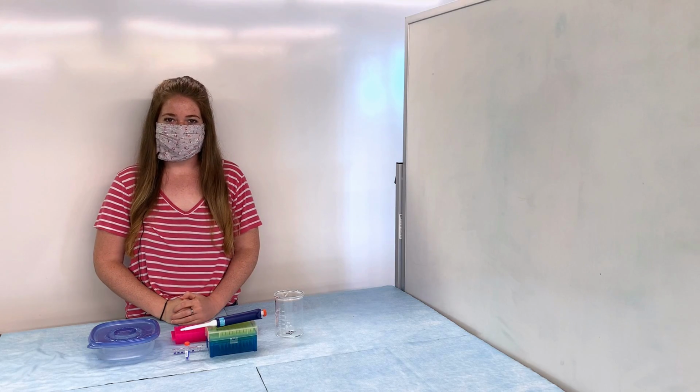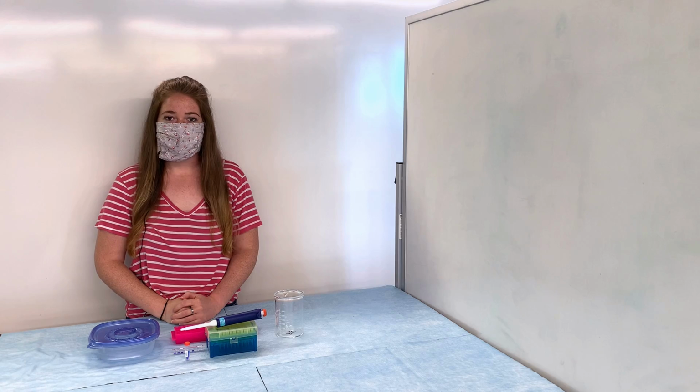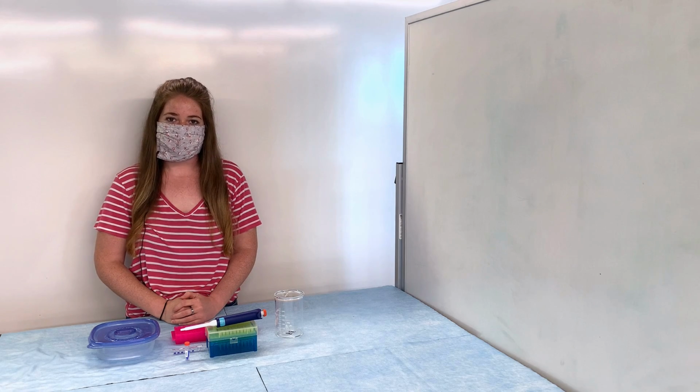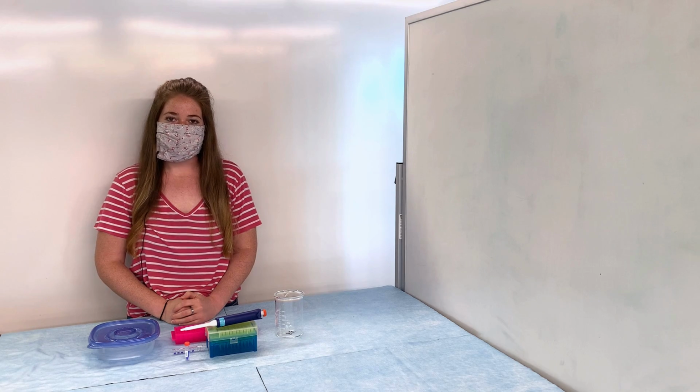Hopefully you remember the last lab, which was an introduction to gel electrophoresis. In this lab, we are going to be continuing our study of electrophoresis, but we're going to be determining whether or not a family has sickle cell anemia. As you read in the introduction, sickle cell is a genetic disease, which means that the genes of those who have it will be different, and thus the disease will cause alterations in the DNA. When you perform gel electrophoresis, different DNA shows up differently.